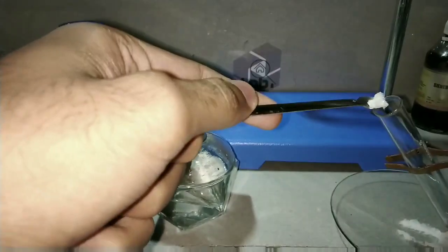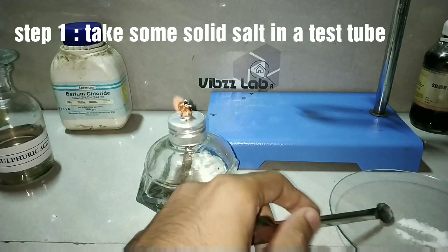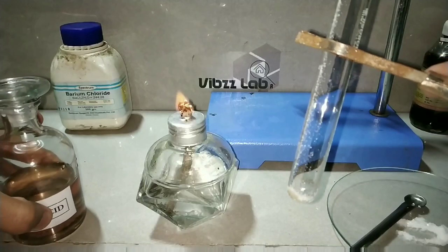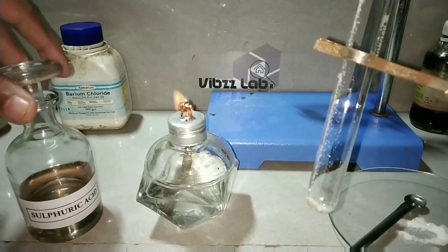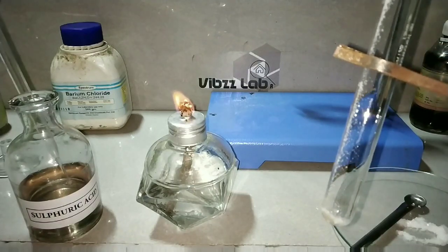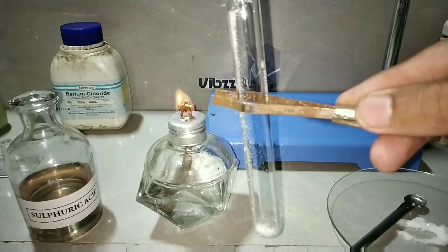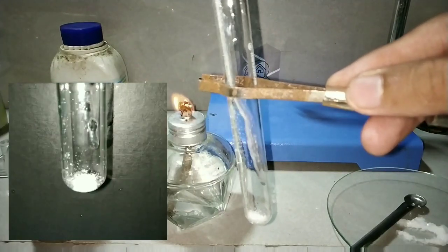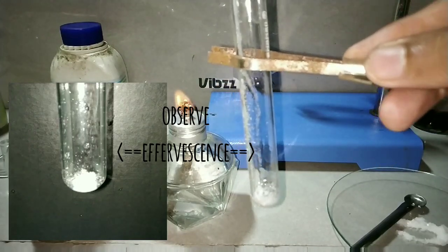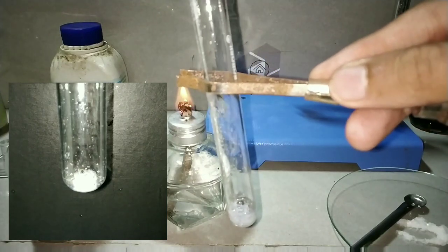Here we are taking a pinch of solid salt into the test tube. The next step is to add concentrated sulfuric acid into the salt. Here we are adding the sulfuric acid dropwise into the salt. As soon as I add the acid, you can see brisk effervescence with the production of gas.